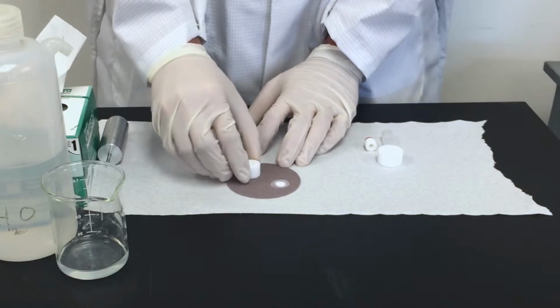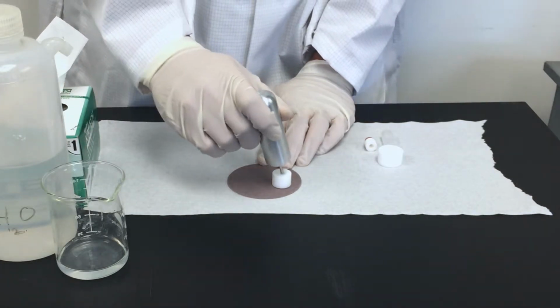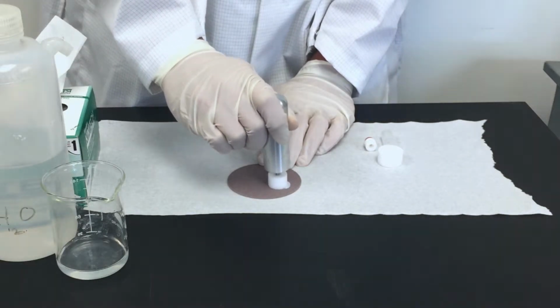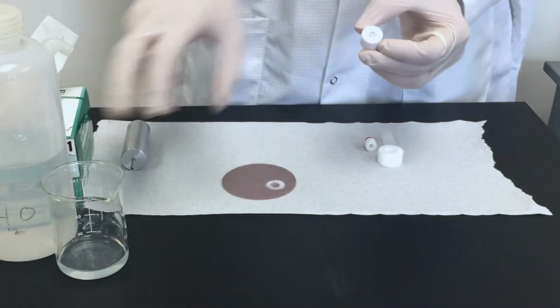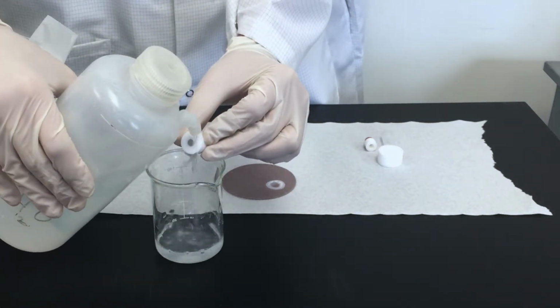Secure the steel sample into the sample holder, then use the metal probe to apply pressure to the steel sample and gently polish the exposed surface. After the surface is sufficiently polished, rinse and wipe the surface using the appropriate techniques previously outlined.